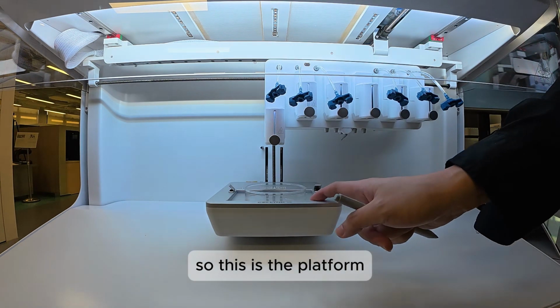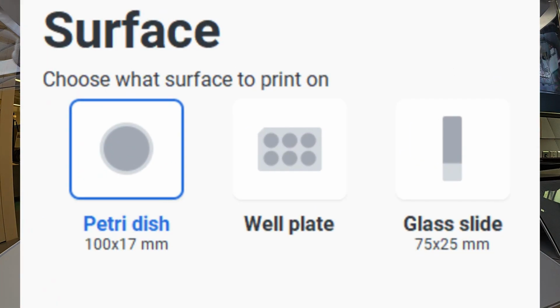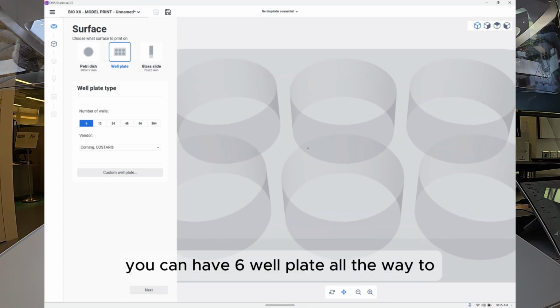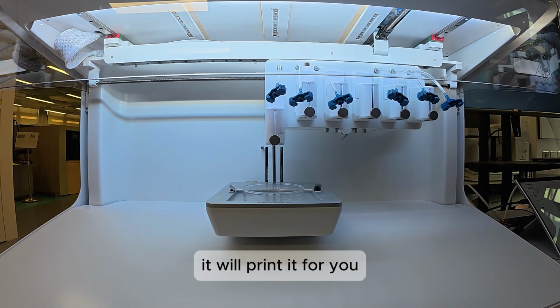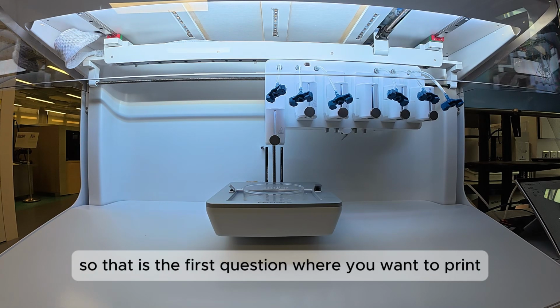So this is the platform. Anything you can fit over here, it will be able to print on top. In this case, it asks us to choose what kind of surface we want to print on. By default it will be Petri dish, but you can choose well plate as well, from 6 well plate all the way to 384 well plate, as long as your 3D model can fit within the well. For demo purposes, I will go with the surface. So that is the first question: where you want to print.